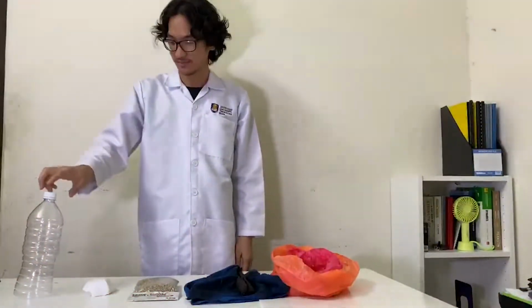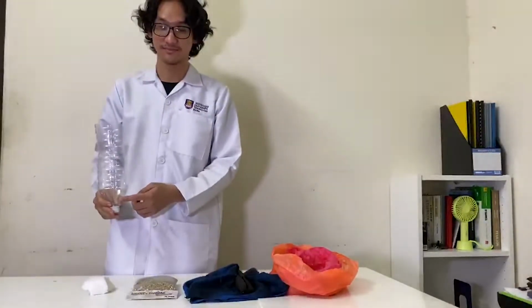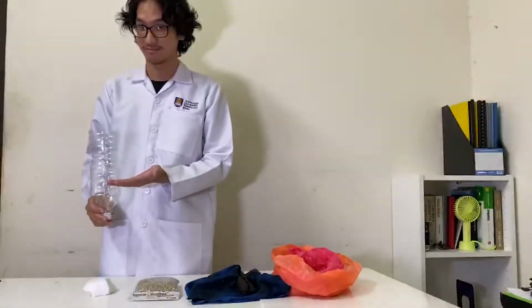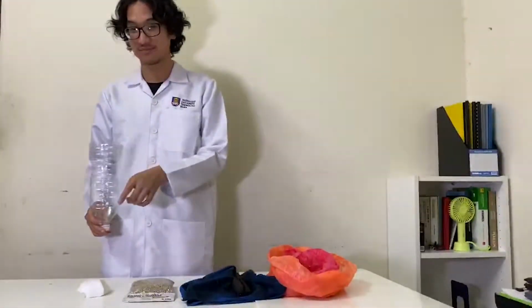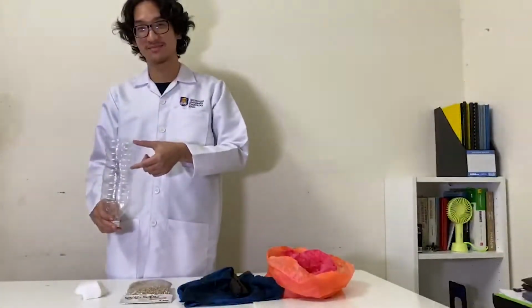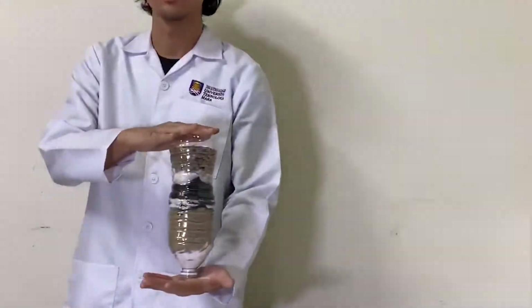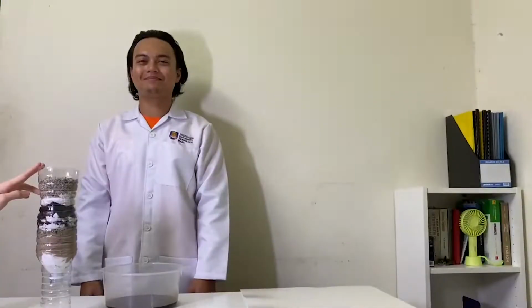Insert about 5 centimeters of the cotton, and the next layer is sand for about 6 centimeters, and we put another layer of cotton, and we put 4 centimeters of charcoal and another layer of cotton, and after that we put small pebble stones for about 3.5 centimeters to create our model. Our model for our filtration system, and here is a brief look at it.